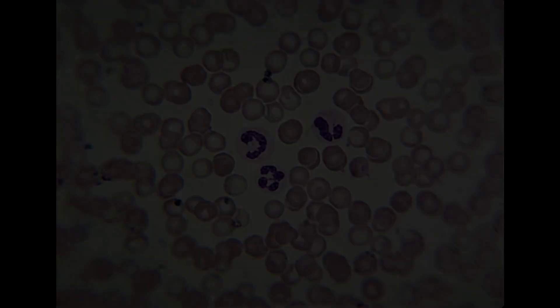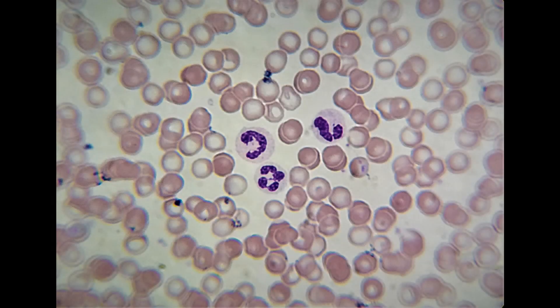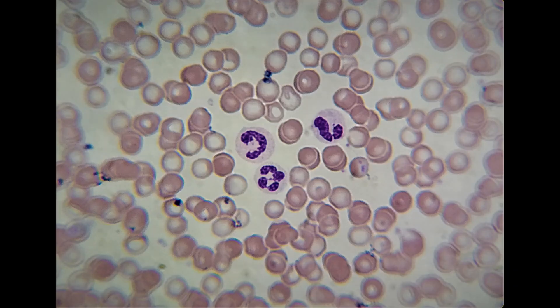In this experiment, we are going to make use of an animal cell, namely human red blood cells, to demonstrate the effect of the three types of tonic solutions on cells.